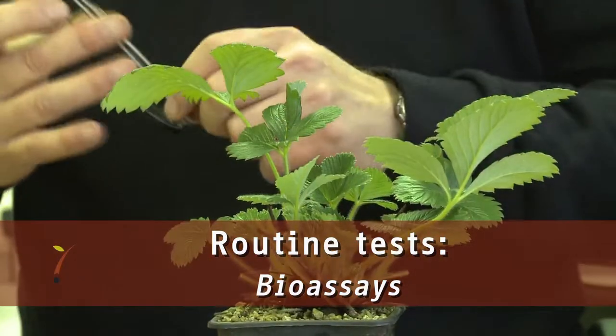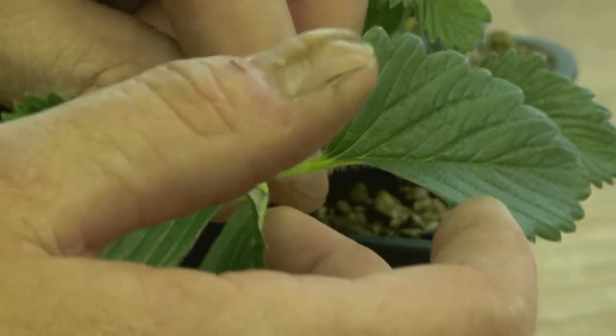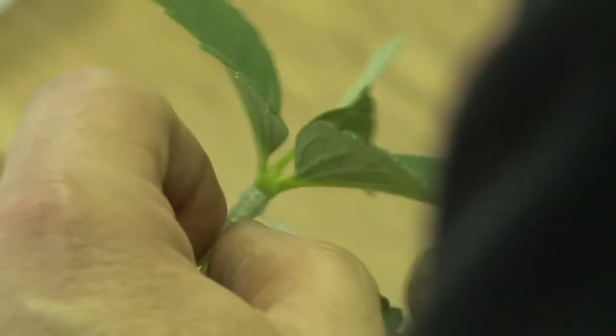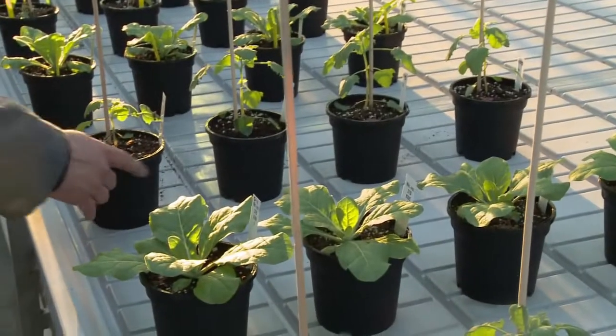Naktuinbouw can also apply specific bioassays, where a leaf or a piece of tissue from the plant to be tested is grafted on woody or herbaceous test plants. These so-called indicator plants are assessed during their development to see whether disease symptoms will develop. This broad-spectrum test allows detection of a broad range of pathogens like viruses, even those that are currently unknown.